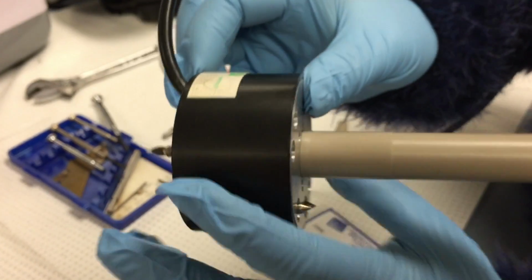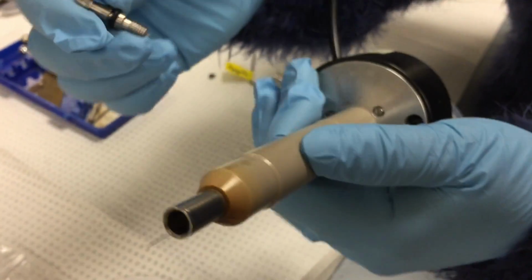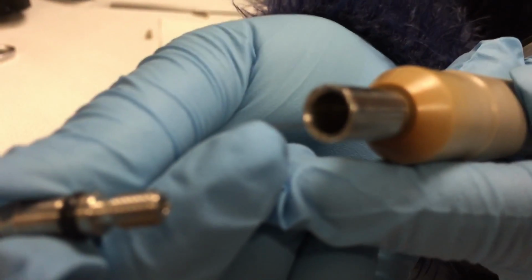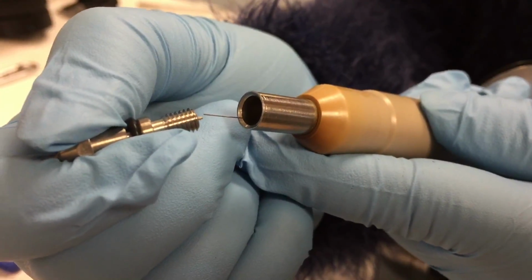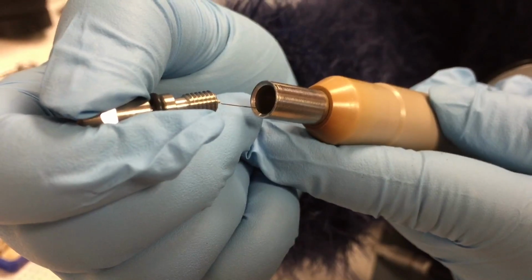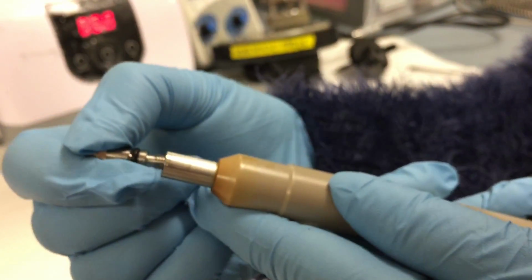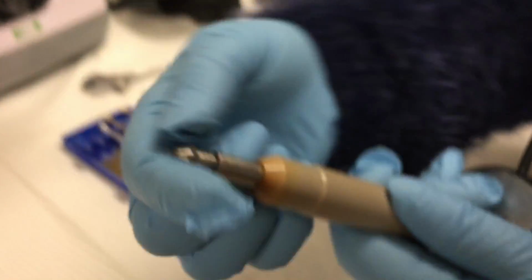Alright, so next I can feed the capillary in through the really small hole on the end of the spray nozzle. Can be really tricky to see. There we go. And then we're going to screw on the head.